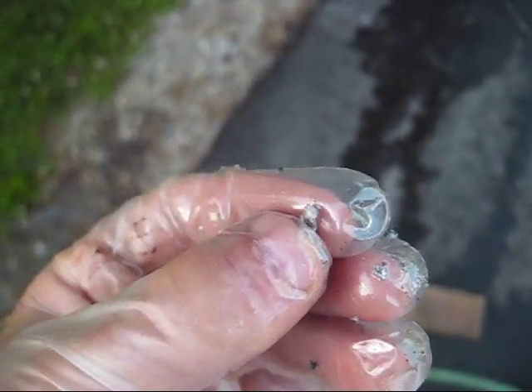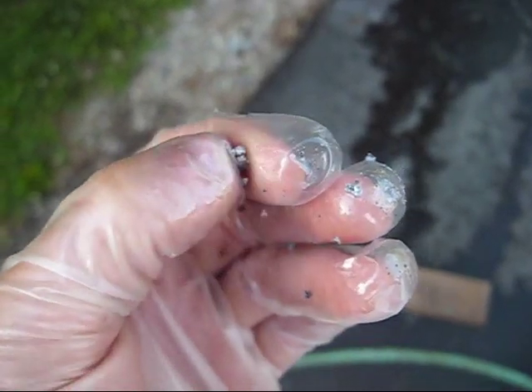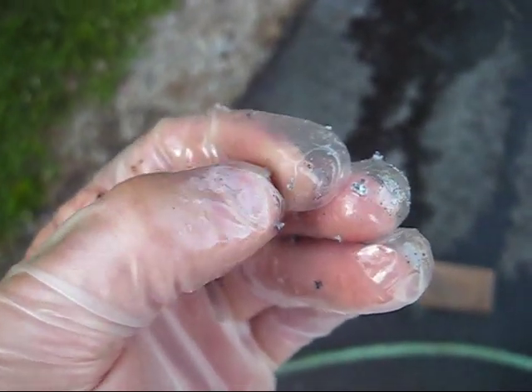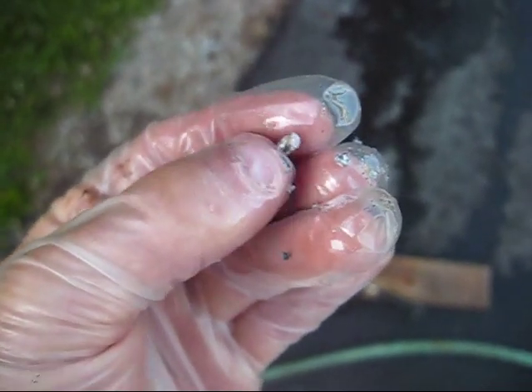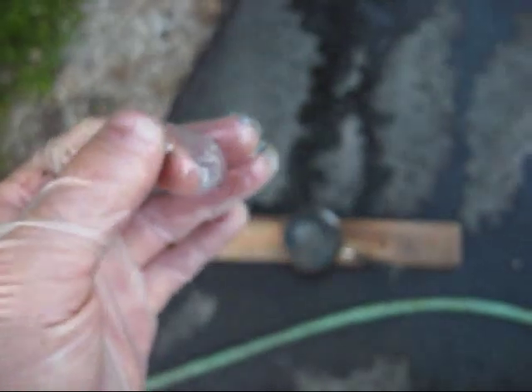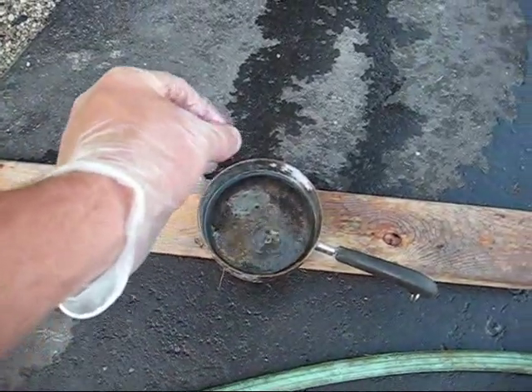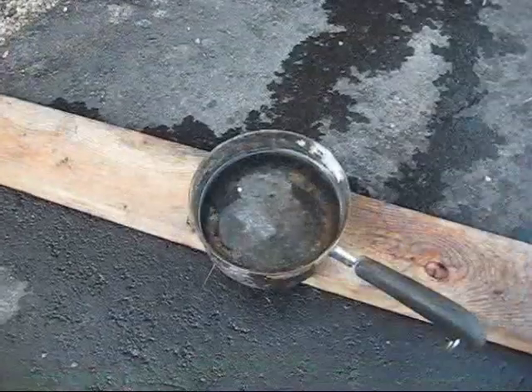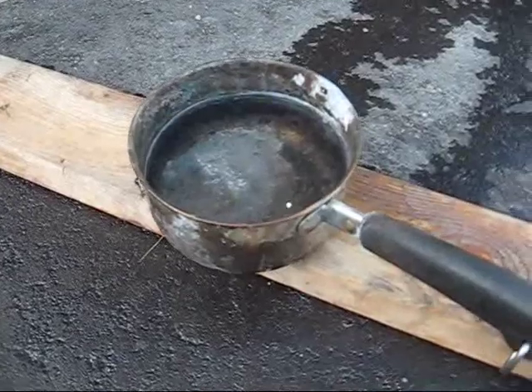First real proof I've seen that this method really creates sodium. It's pretty easy to tell if you've experimented like this at all — it's very obviously sodium and not an alloy of some kind. So let's give this a shot in the pot of water down there. I don't know if you can see the ball that has formed, zipping around on the top of the water there.